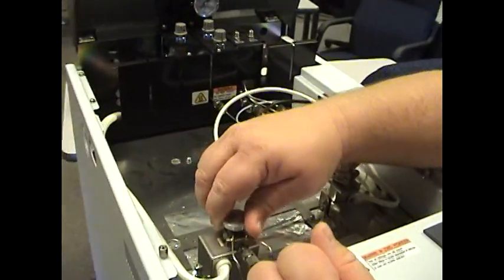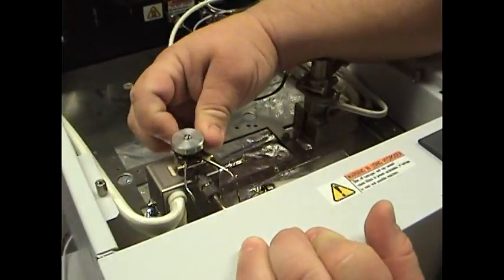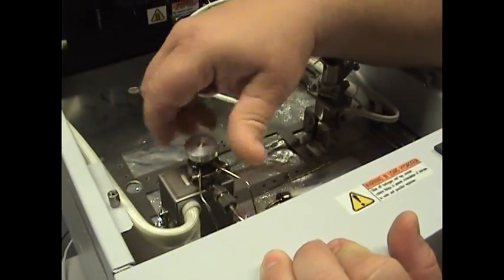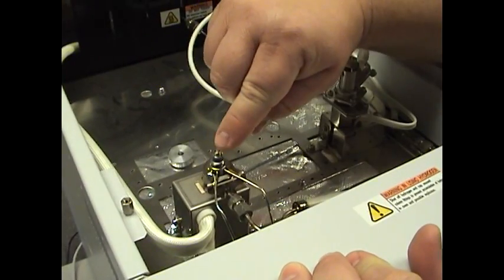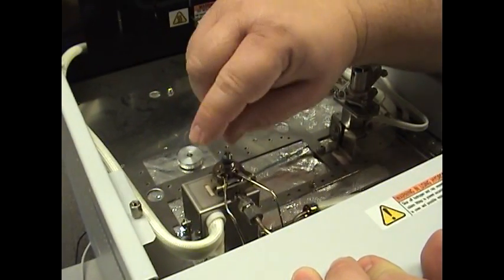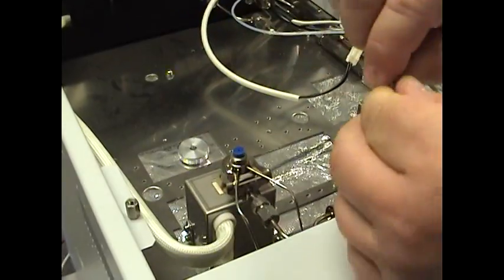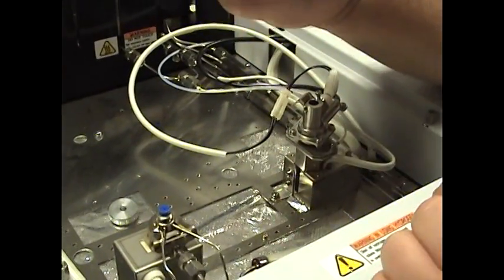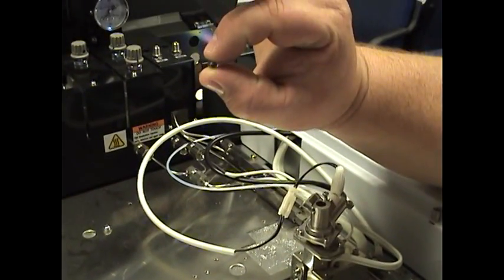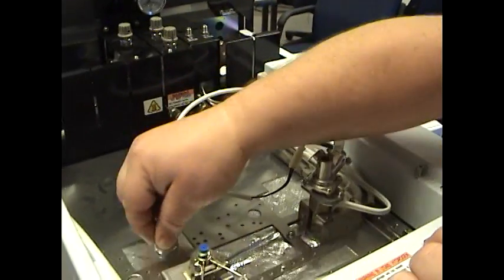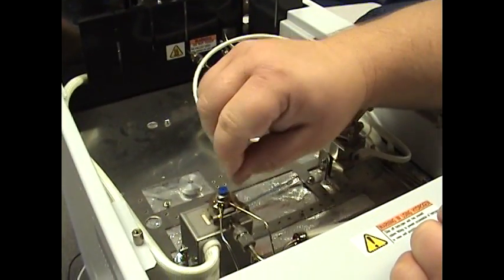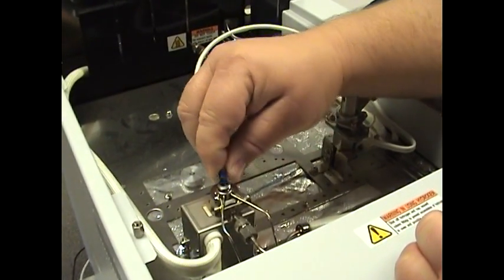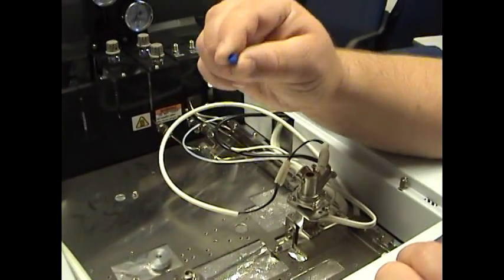Alright, if that's zero and everything's cool, we simply unscrew the nut. Here's the injection port guide. We take that off. It's good to blow some air through the liner or the guide to make sure it's clear. This is your SEPTA. This should be replaced after at least every 100 injections.